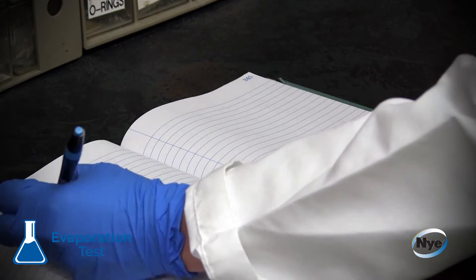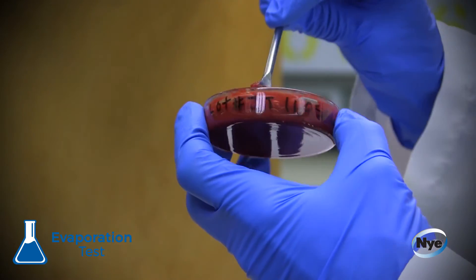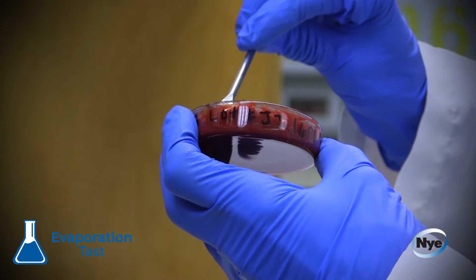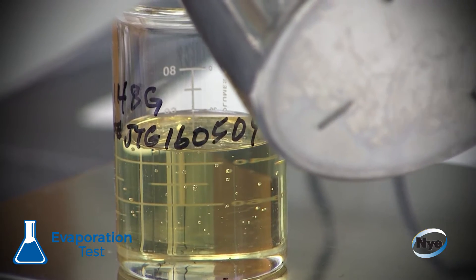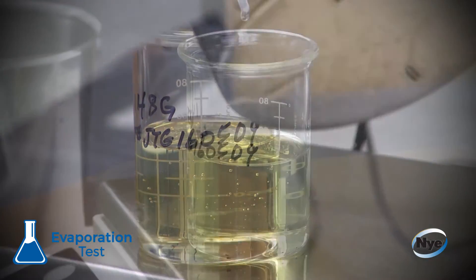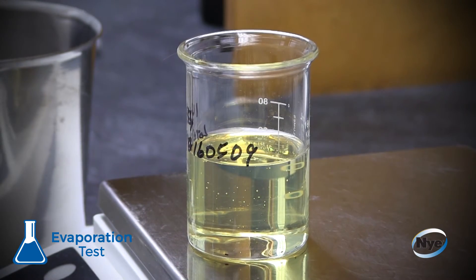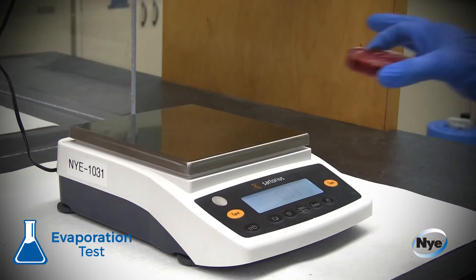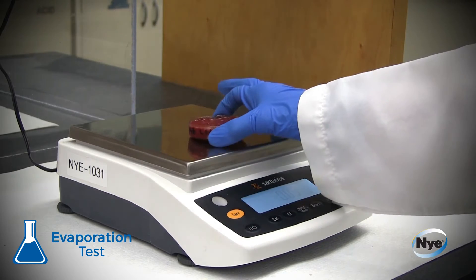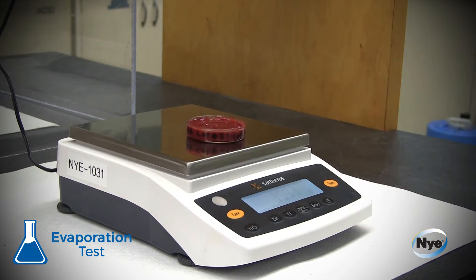Then the technician will smooth a 25 gram sample of grease into a petri dish, or a 50 milliliter sample of oil is poured into a 100 milliliter beaker. The dish or beaker is weighed again and the number is recorded.